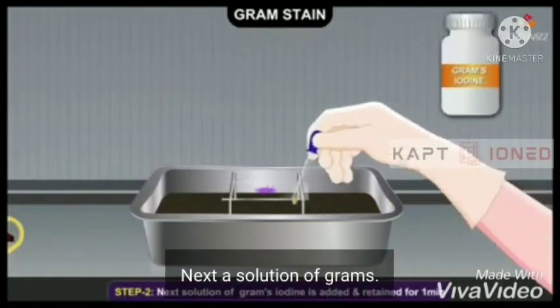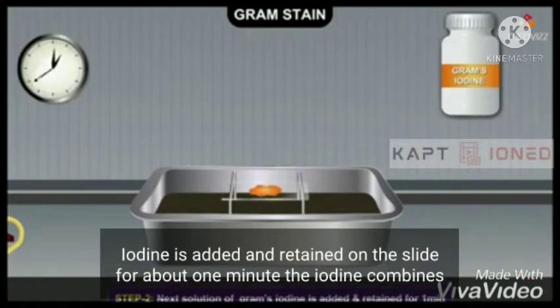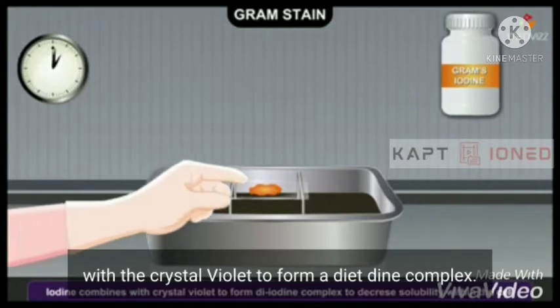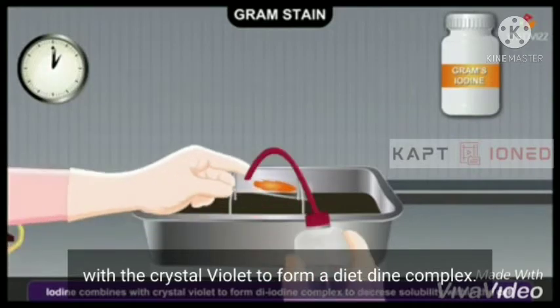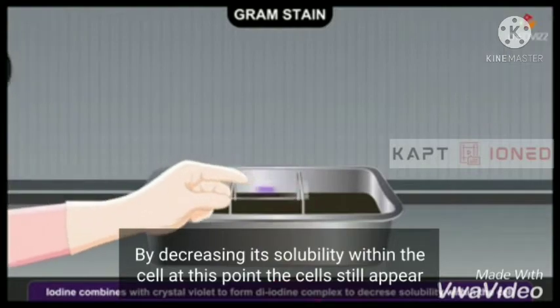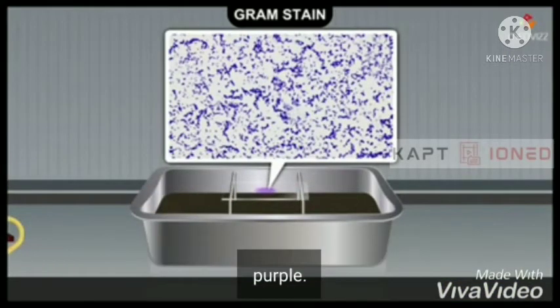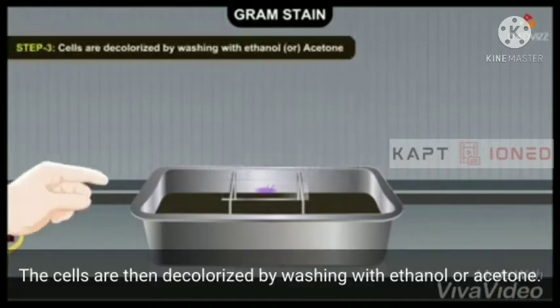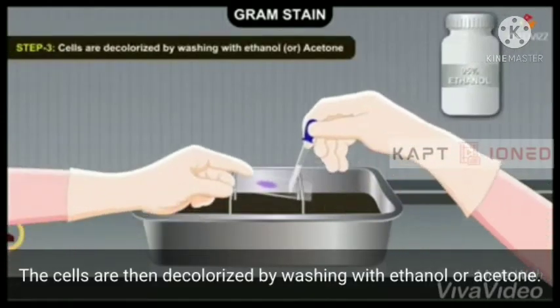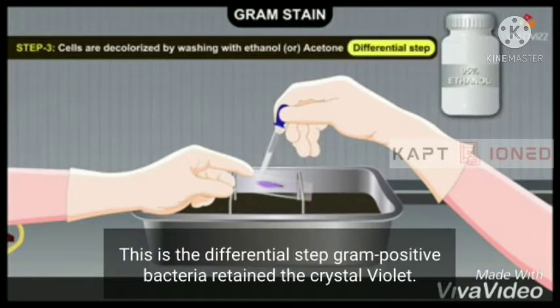Next, a solution of Gram's iodine is added and retained on the slide for about one minute. The iodine combines with the crystal violet to form a dye-iodine complex, thereby decreasing its solubility within the cell. At this point the cells still appear purple. The cells are then decolorized by washing with ethanol or acetone — this is the differential step.